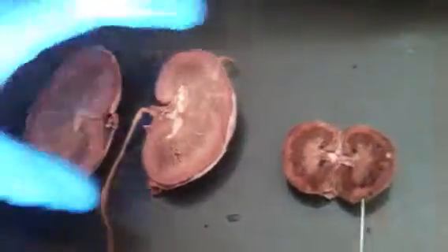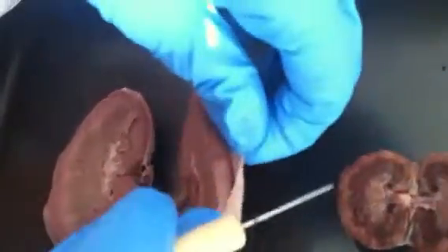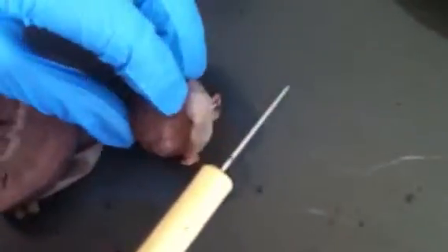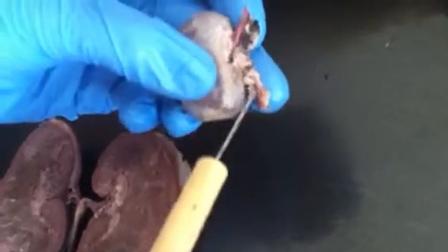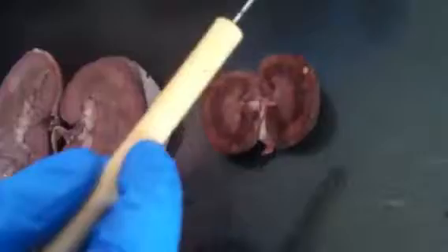Okay. Then this kidney, and this is the renal capsule on the outside, the covering that you can take off. And this is the renal capsule on this side. Here, and if you put it back together, you can see the renal artery, the renal vein, and the ureter, which I cut, but obviously it's much longer and connects to the bladder, which you can see over here.